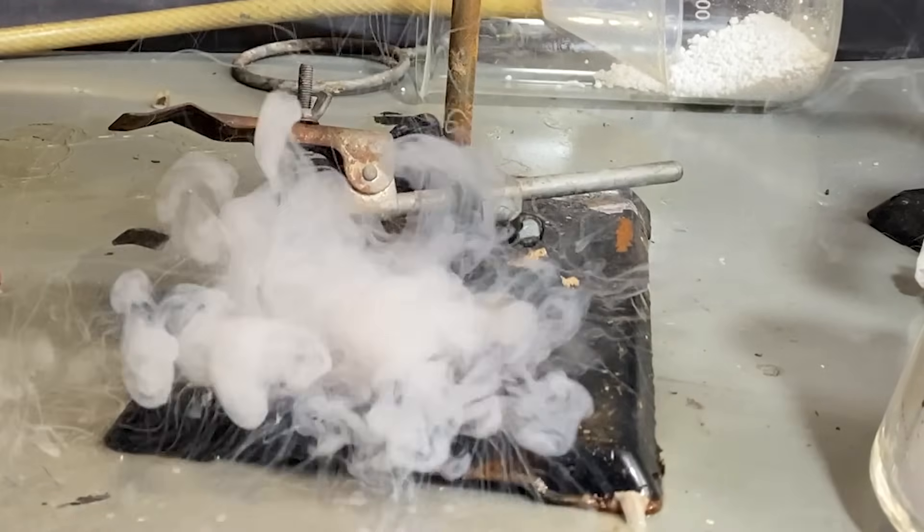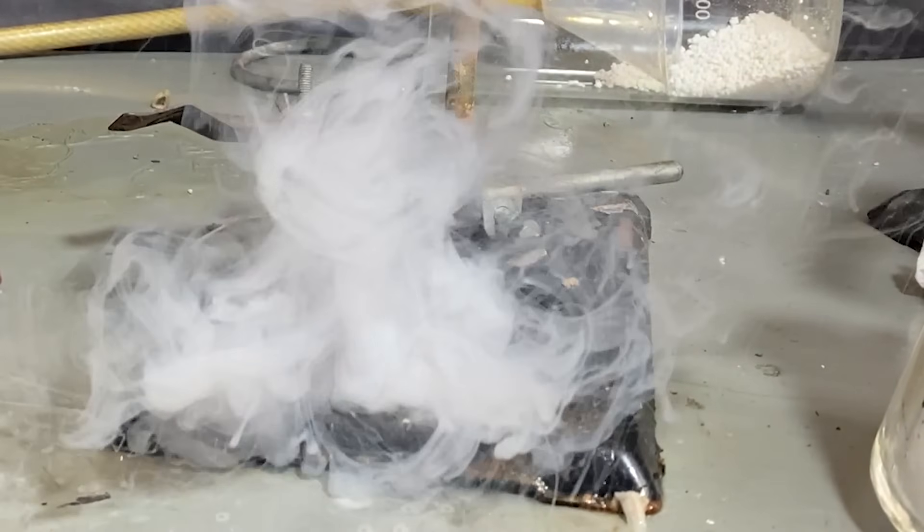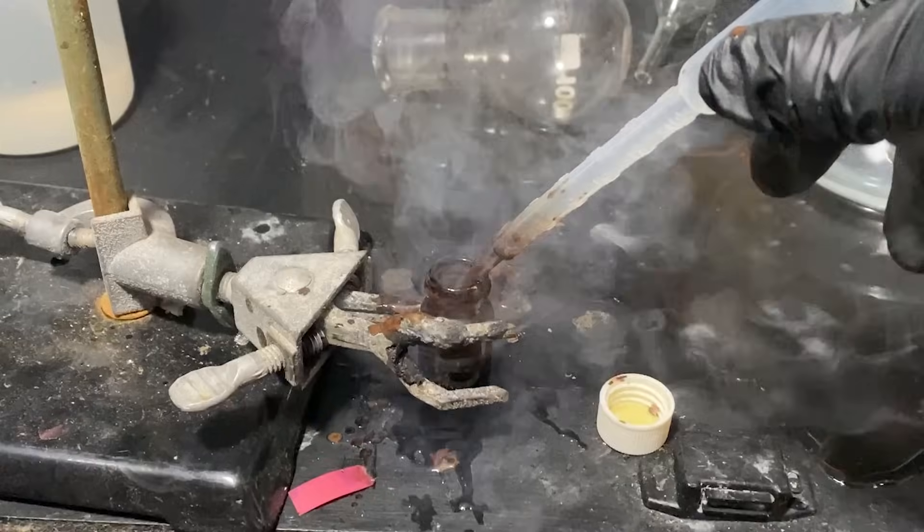You know, if I had a nickel every time I spilled chlorosulfonic acid, I would have two. I mean, it's not that much in terms of money, it's just weird it happened twice.